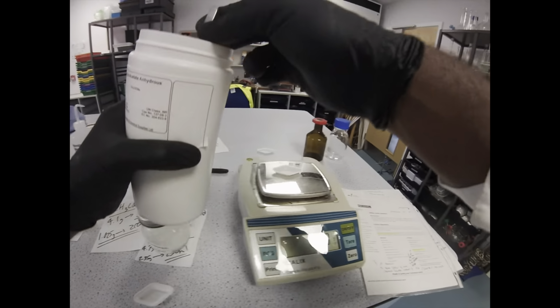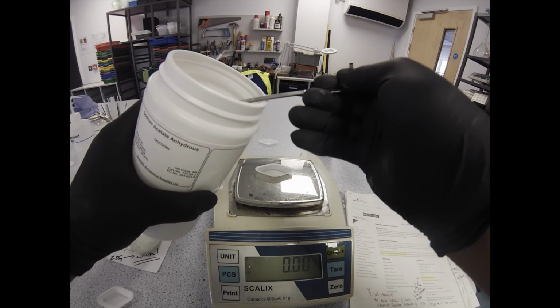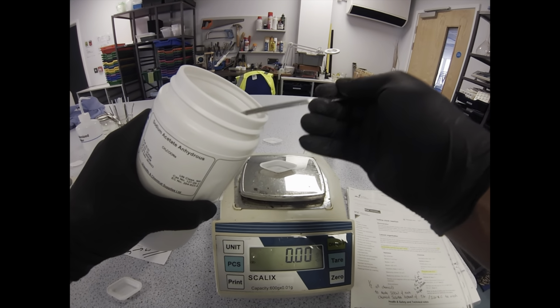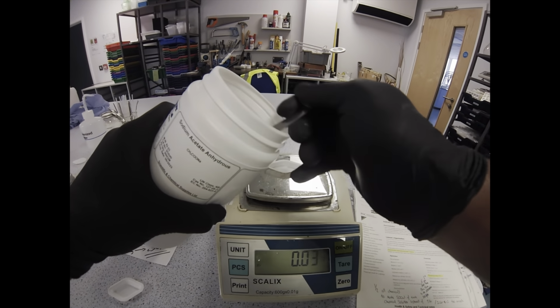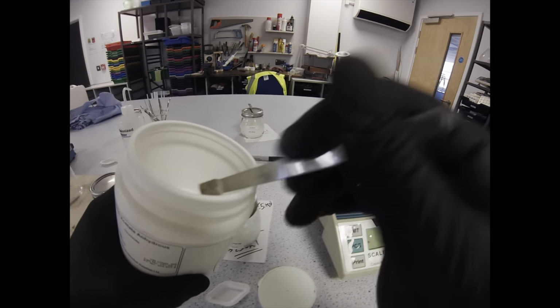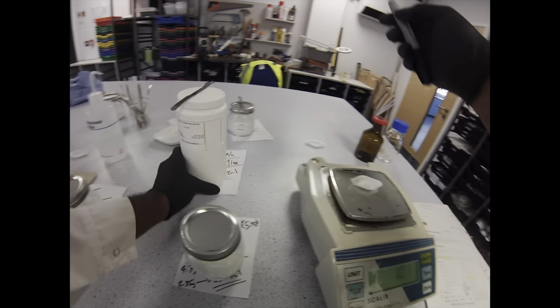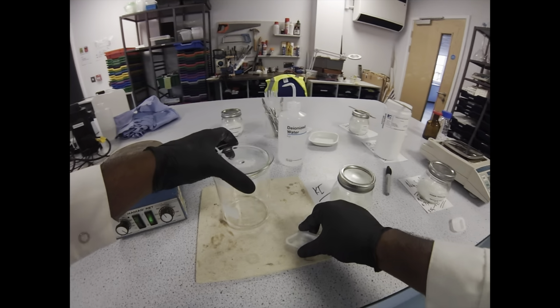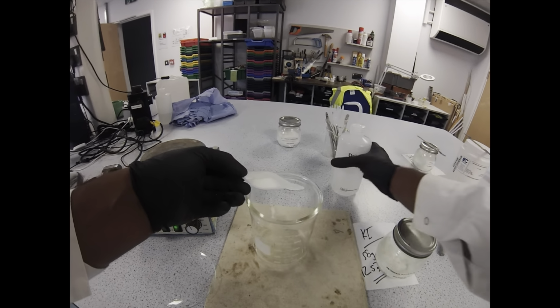Okay, sodium acetate now. That's going to be part of our buffering system, working in conjunction with the acetic acid. We need hydrogen ions in our solution, so we need to keep everything acidic. I have seen recipes that use sulfuric acid instead. I will go into exactly why we need those hydrogen ions a little bit later. Okay, so that's our acetate done. Let's add that into the solution, dropping it in from the weighing boat with plenty of rinses.